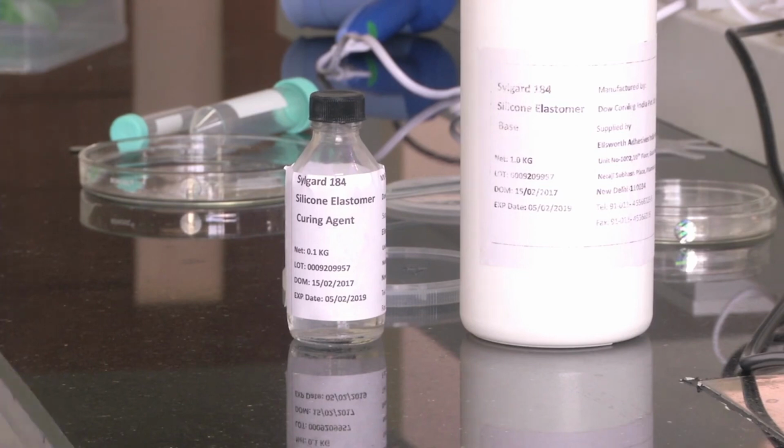Once that mix is ready, we will take that mix and pour it on a petri dish that is containing our silicon master. Then we will have a dish containing the PDMS and curing agent mix with the silicon master at the bottom. That dish, we will keep at around 60 to 70 degrees Celsius for 2 to 3 hours inside the oven. After that, if you take it out, we will see that the PDMS has become cured and it has become a solid layer. Then whatever dimensions we need, we can cut out that PDMS from it. This is the overall process which we will be showing to you today.